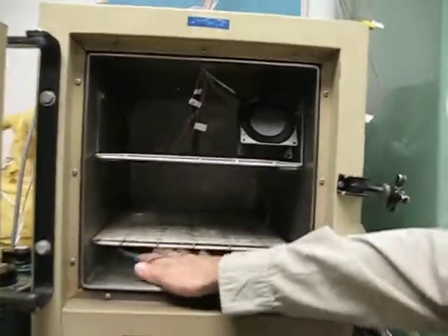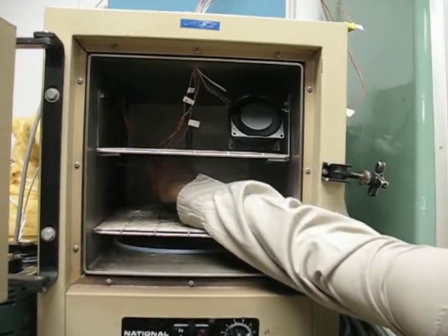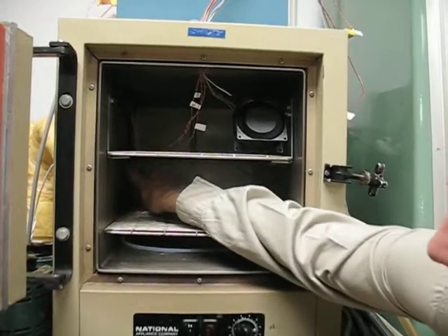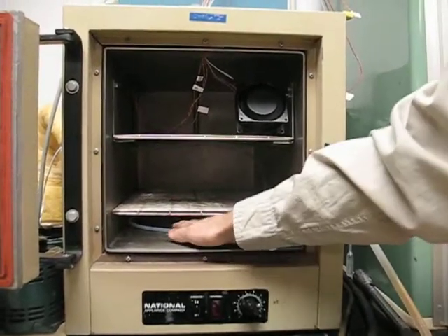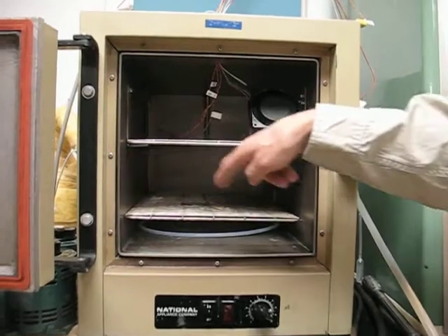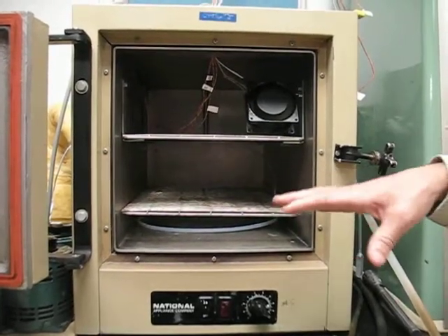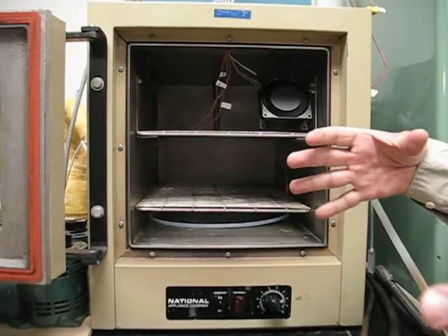This is where the humidified and heated air comes in to the furnace, and then it enters this ring at the bottom of the furnace that has a series of 1/8-inch holes drilled 3 inches apart around the ring. We grossly measured the flow out of each of these to be even.